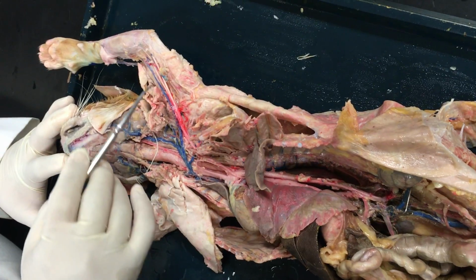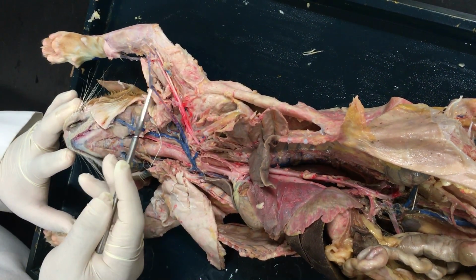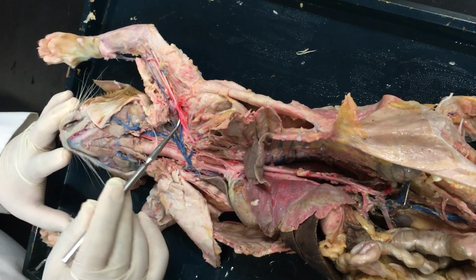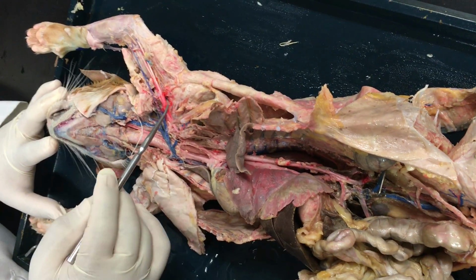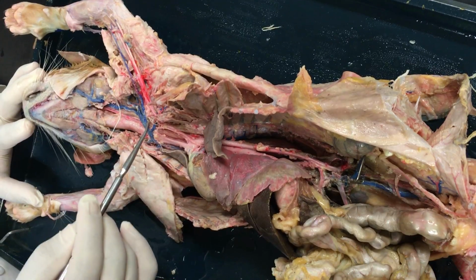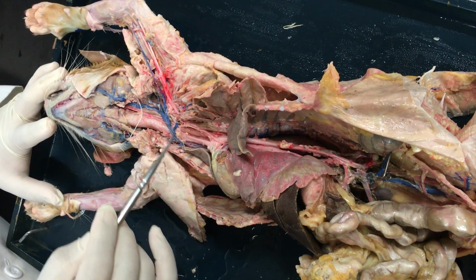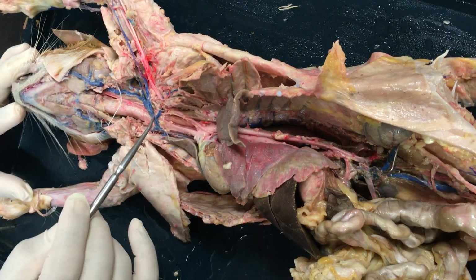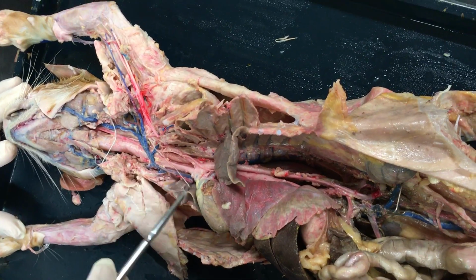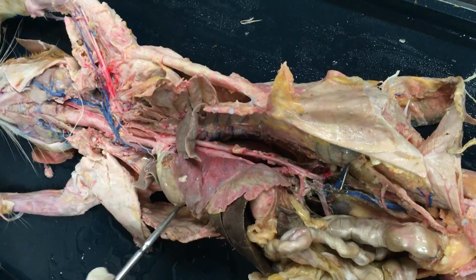As we make our way back, now we're draining these regions. You have your brachial vein. And again, that brachial vein, as it moves out of the brachial region into the axillary region, becomes the axillary vein. As it comes back into the rib cage, the subclavian vein, very brief segment here. Then that drains into the brachiocephalic vein. And notice the Y-shaped structure here. Those are the two brachiocephalic veins. They merge together to form the superior vena cava. And then that superior vena cava, of course, drains into the right atrium.